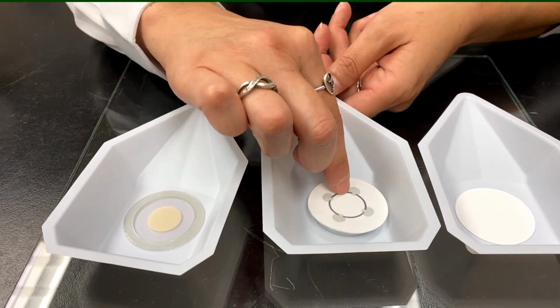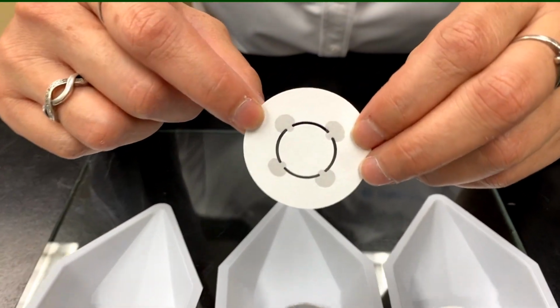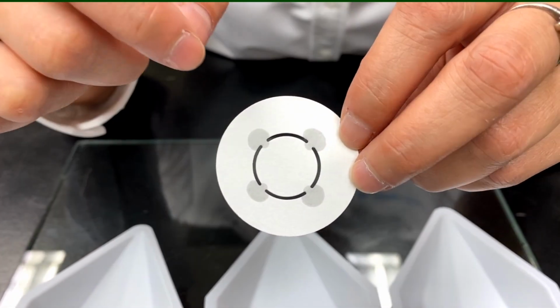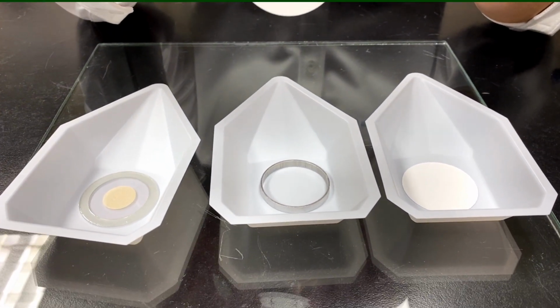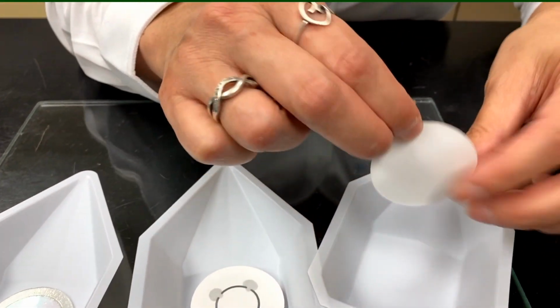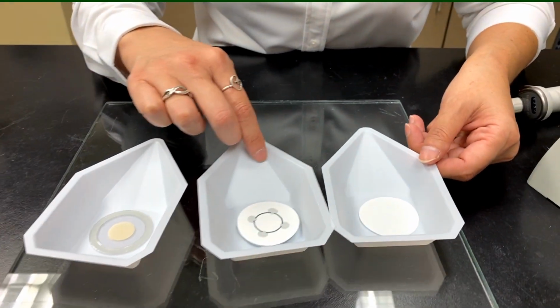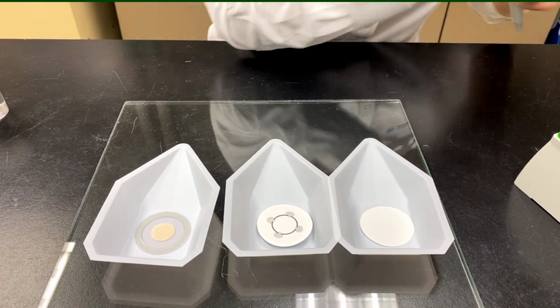Another option that we have here is called the Micro Carry. It's basically a filter paper with wax bridges on there. What the wax bridges do is keep the liquid right in the center of it. So this one uses about 100 microliters of sample. And then the traditional way is just a Whatman filter paper, about 42.5 millimeter diameter. All of these will use roughly half a mil. You should not have to use any more than that.